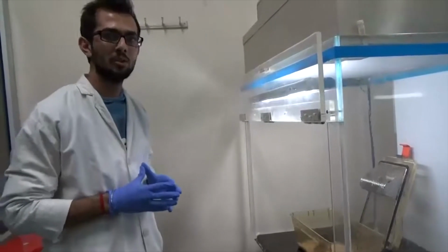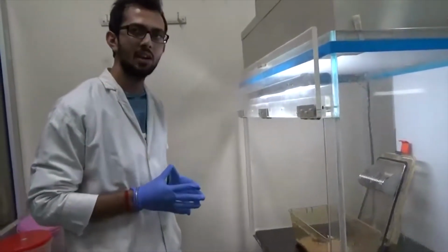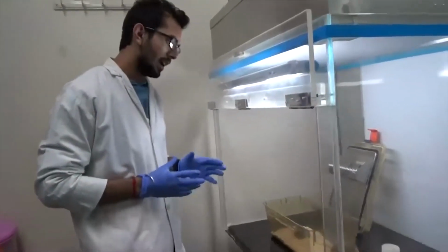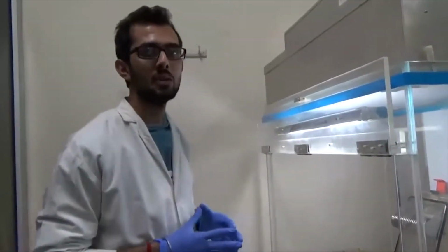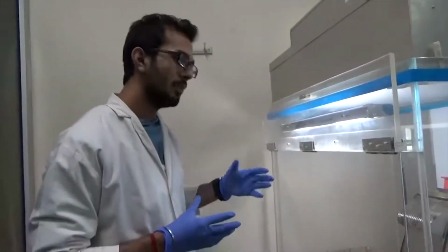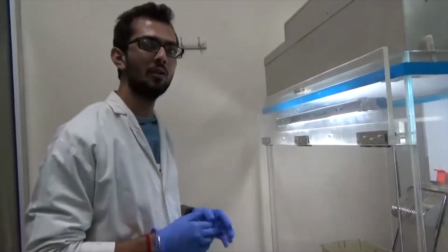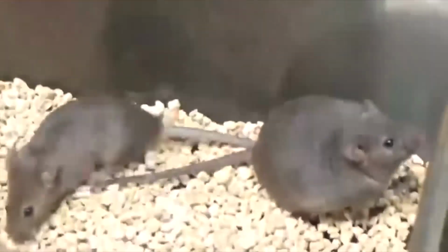Once the gene responsible is known, we can have a detailed understanding of the function of that gene by various other experiments. And if the phenotype of the mutation is related to some human disease, the mice can be used as the model for getting a detailed understanding of that disease. For example, here we can see these two mice, both born to the same mother and of the same age, but you can appreciate the difference in their sizes.